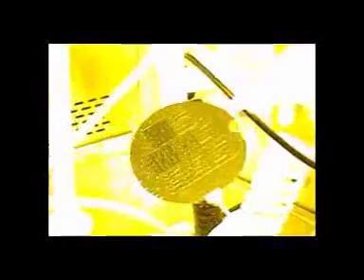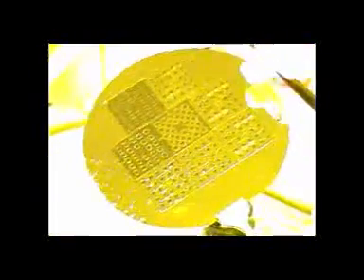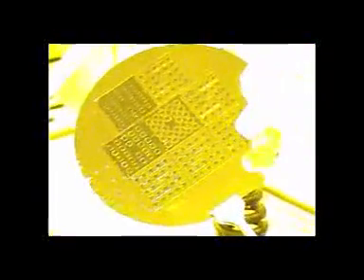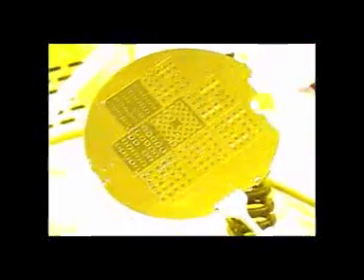You may do an optional hard bake at above 120 degrees for 5 to 30 minutes.